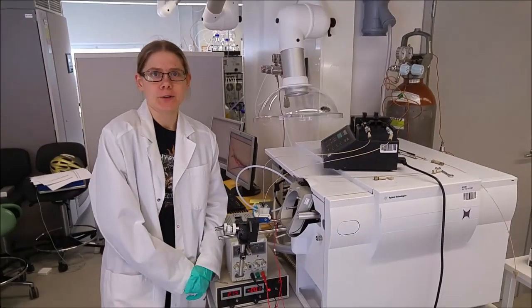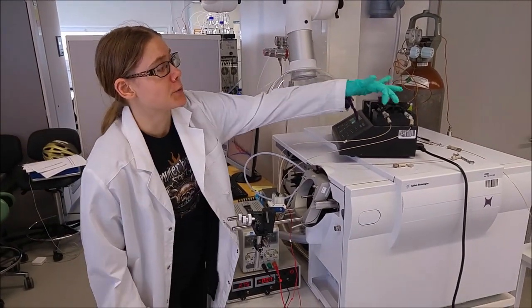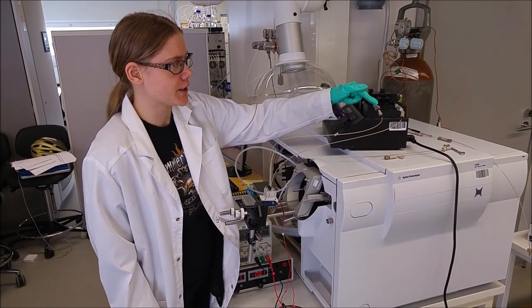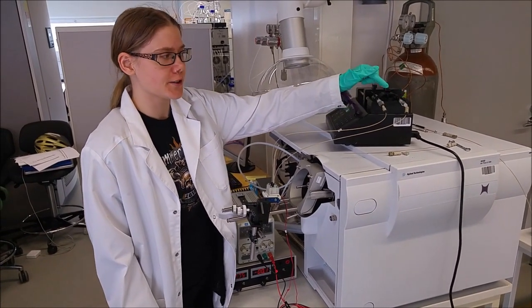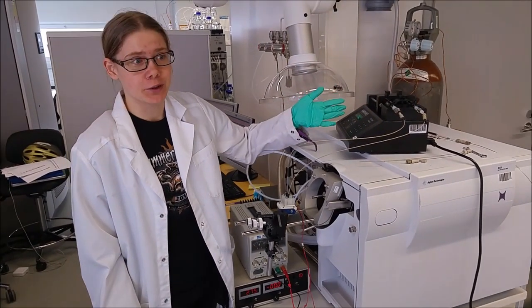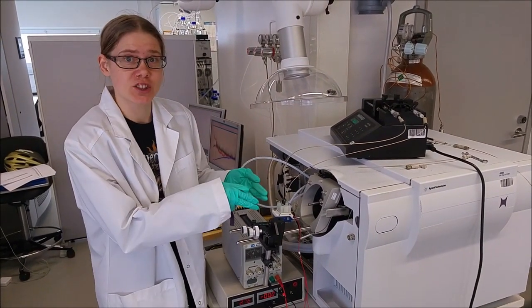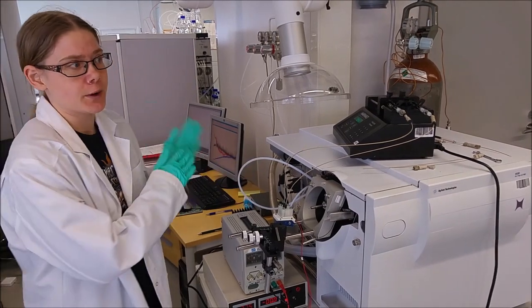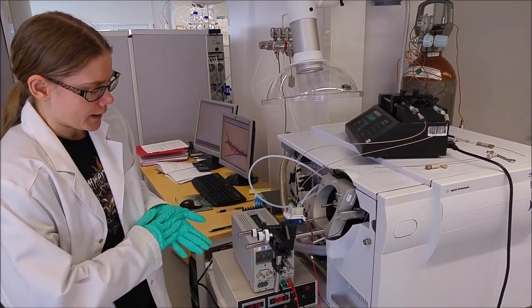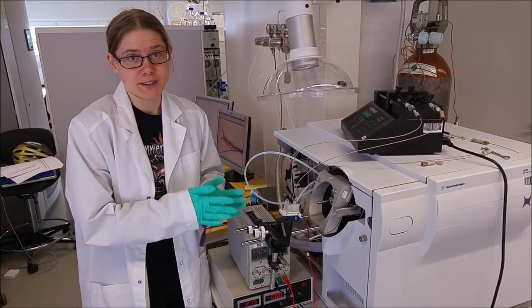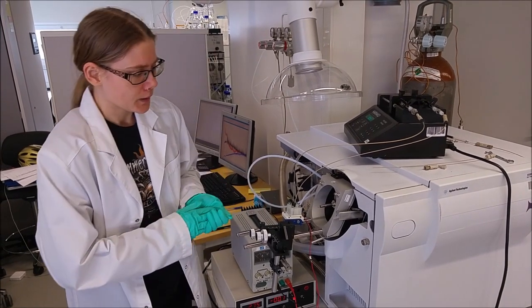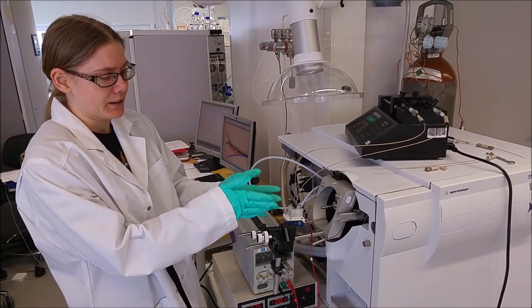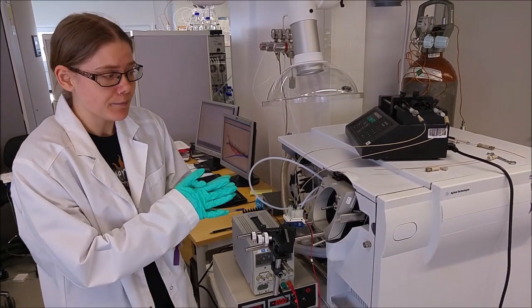So we carry out the experiment by filling these two syringes with reactants. We have tetrazine in one of the syringes and trans-cyclooctene in the other syringe. Then we start the infusion so that we fill the reaction chamber of the chip, stop the infusion, start the recording of the mass spectrum, and also turn on the voltage supply so that we achieve stirring of the stir bar. And then we continuously monitor what is happening within the reaction chamber with the mass spectra.